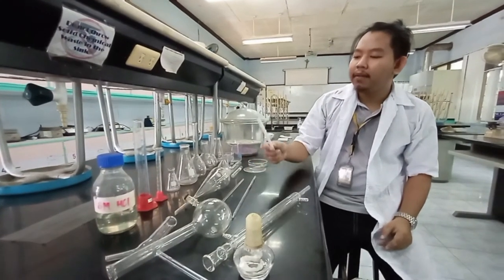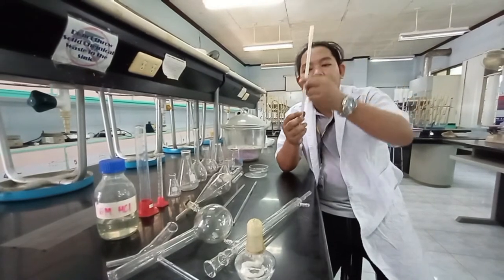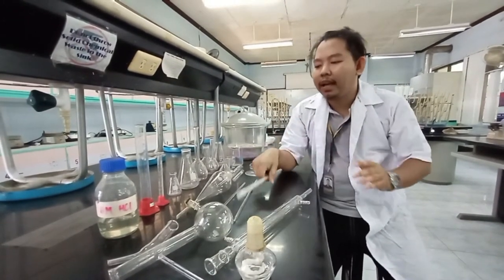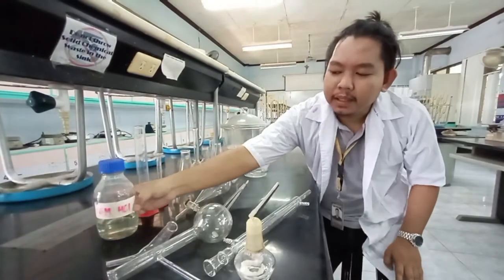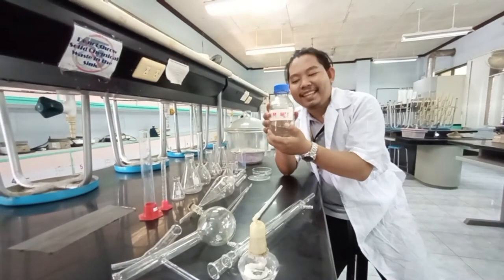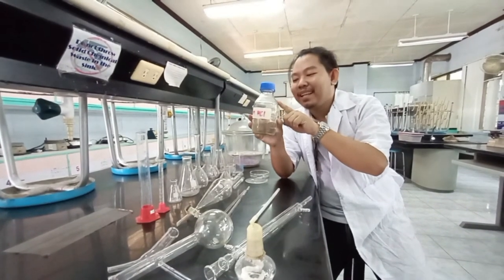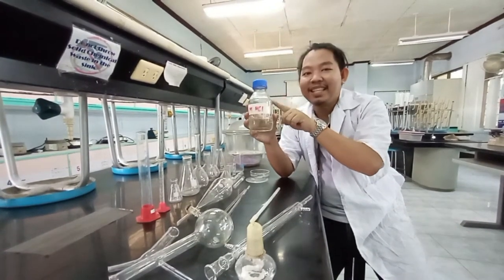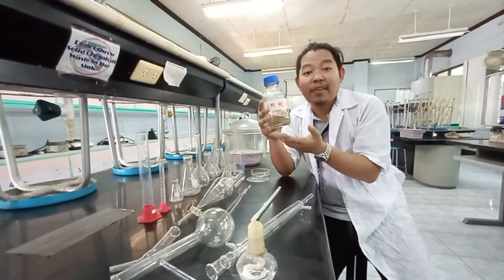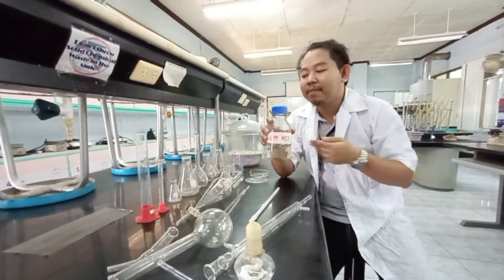And we have here the thermometer — a room thermometer in particular. For sure, you are all familiar with the thermometer. And here we have a hydrochloric acid bottle. Note: the equipment is the reagent bottle. We use this to contain or to store different chemicals in particular.